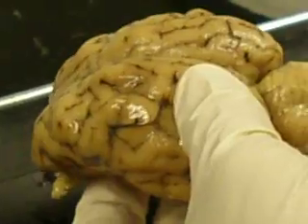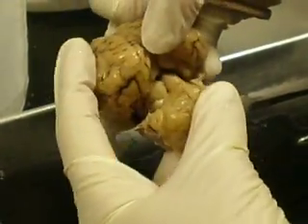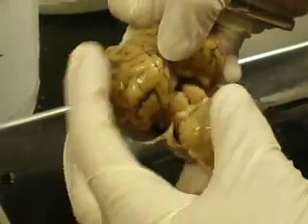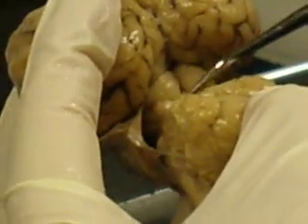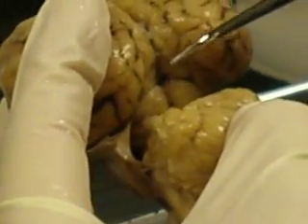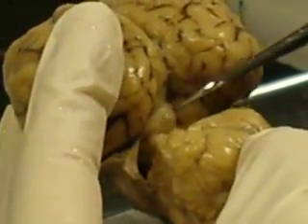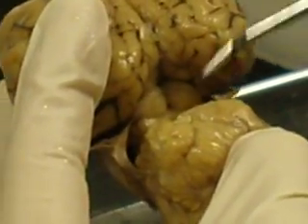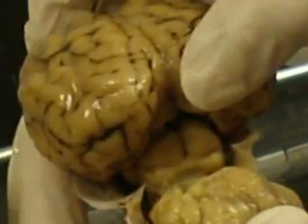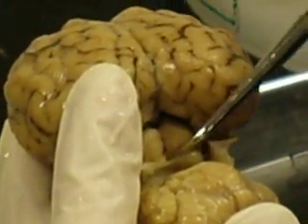This is the cerebellum. If you open this up, you can see the corpora quadrigemina — these four bumps right here. The top ones, the bigger ones, are the superior colliculi. Underneath you can see the inferior colliculi, these two right here.